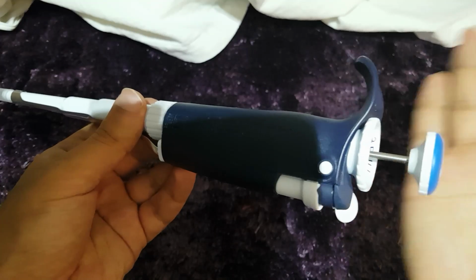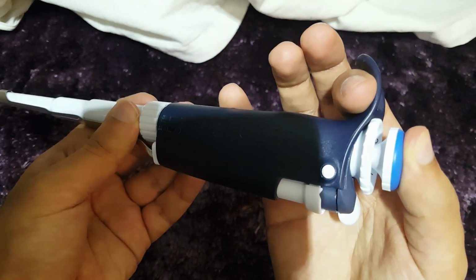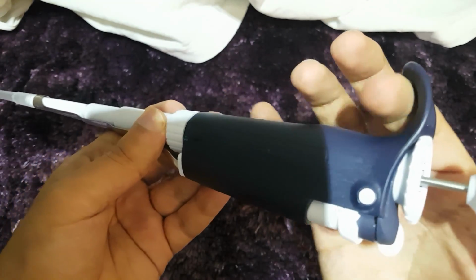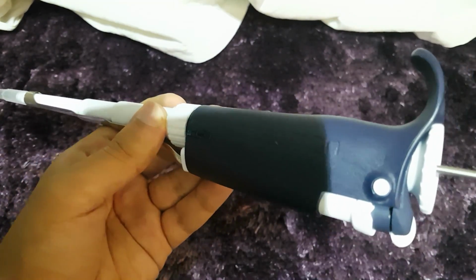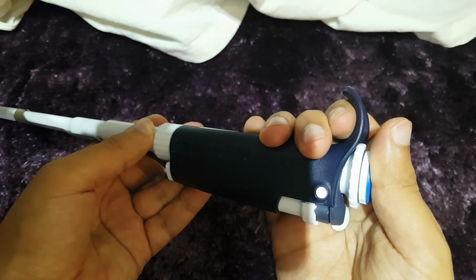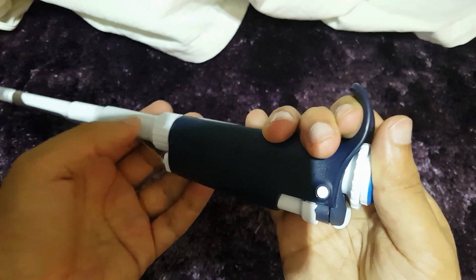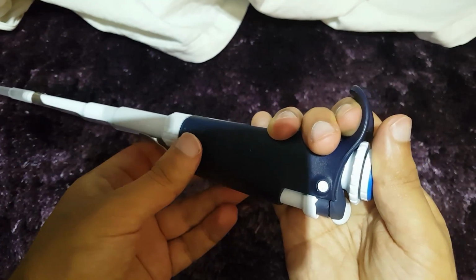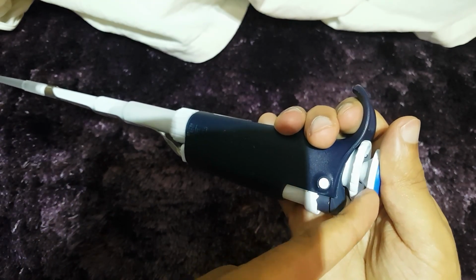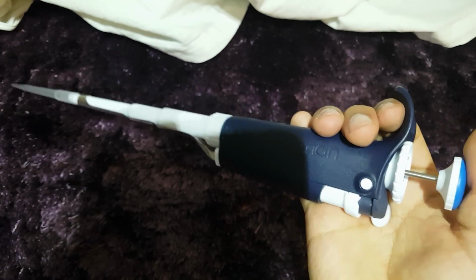Now, say you want to eject the fluid you have in your tip. You simply push this down, and you push down a little harder because there's a second click. This ensures that all the liquid in the pipette comes out. However, when you're pipetting up, you should not pipette from the second point down, mainly because that will not be 750 microliters, for example. You should always pipette from the first click. As you can see, second click, first click. When pipetting up, you always go up like that.